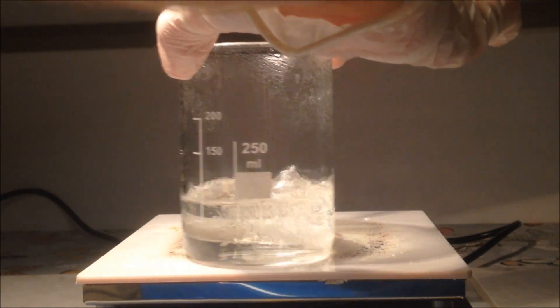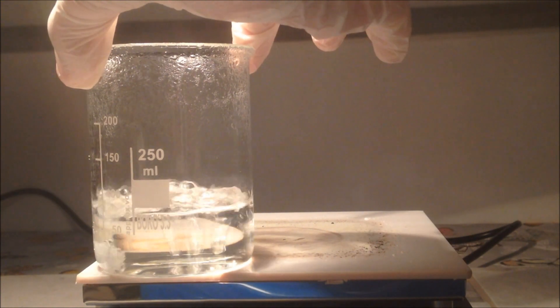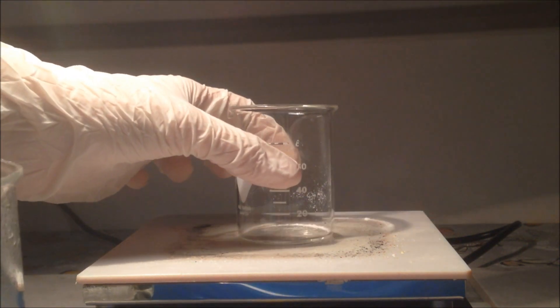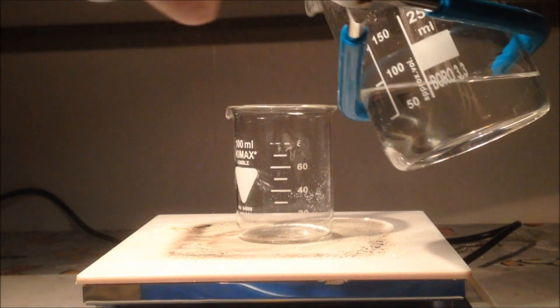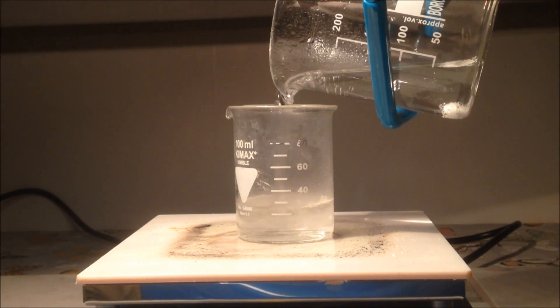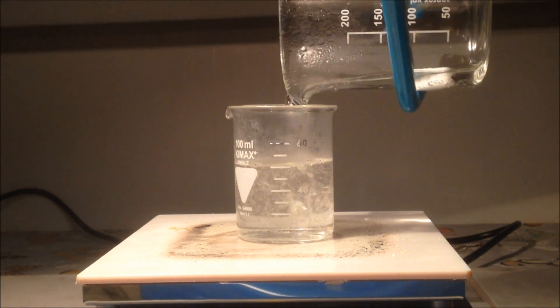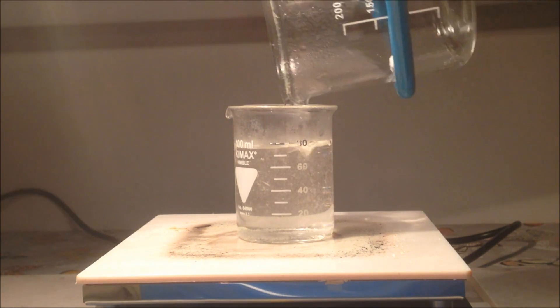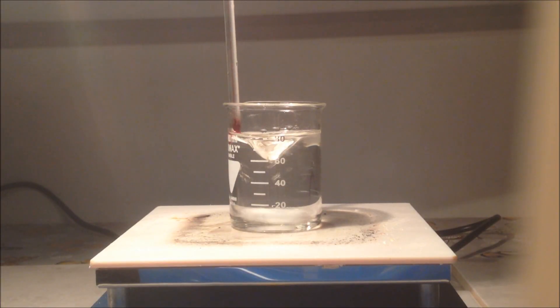When it got down to about 80 millilitres, I transferred it into a smaller beaker to allow for quicker evaporation. You probably don't need to use 100 millilitres of distilled water if you're doing the same thing as me - you could probably get away with 50 millilitres. Either way, you get to the same result of concentrating the solution.